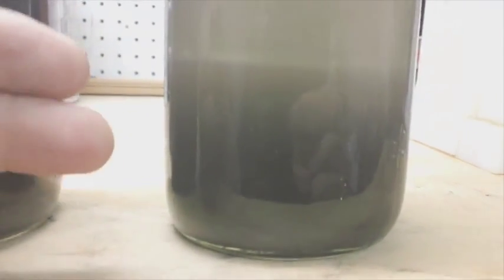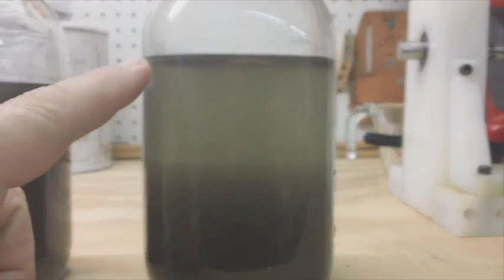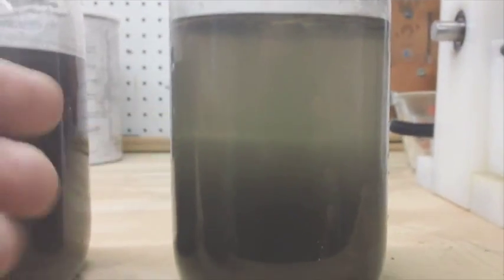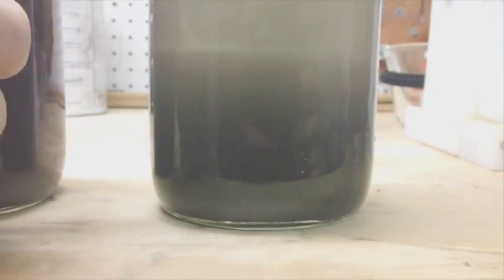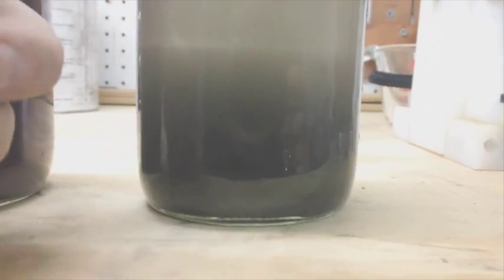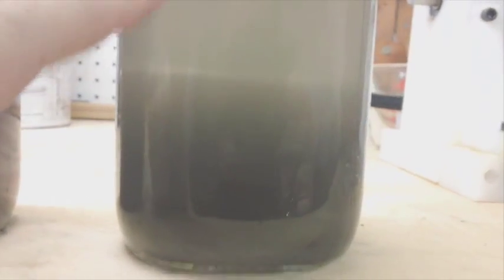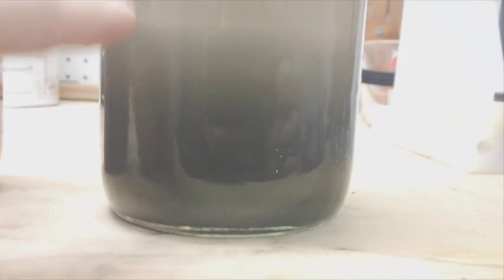Acetone is lighter than water, so you can see the graphene. Because graphene is a single layer of graphite, it's transparent, and the density of the top layer there is the graphene multiple layers floating in the acetone. There's a distinct line here. Now I'm not sure what the quality of the graphene is below this level down here.